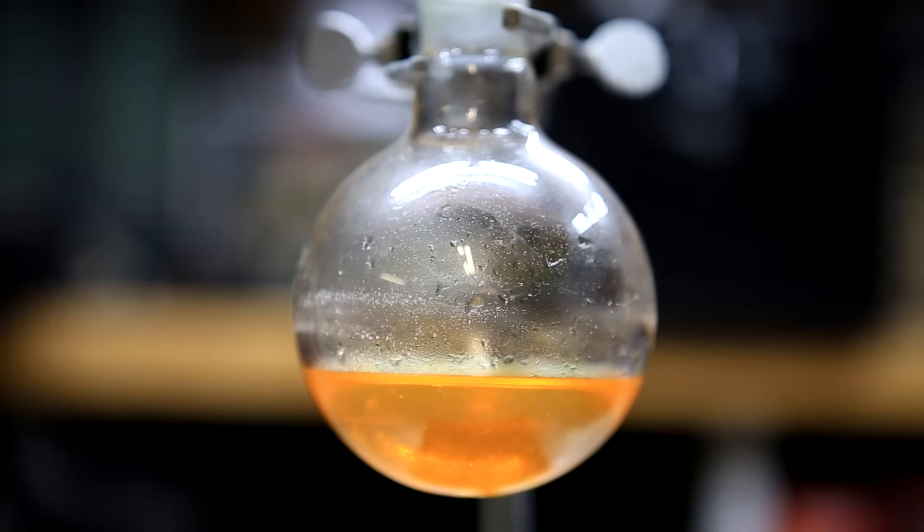This is the crude yield of benzene. You can clearly tell by its orange color that it's not pure.